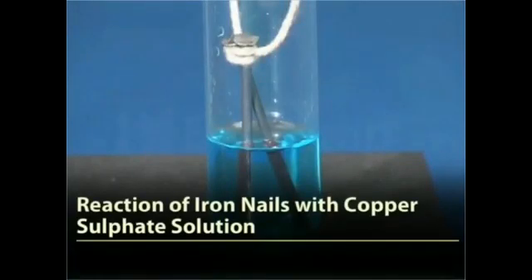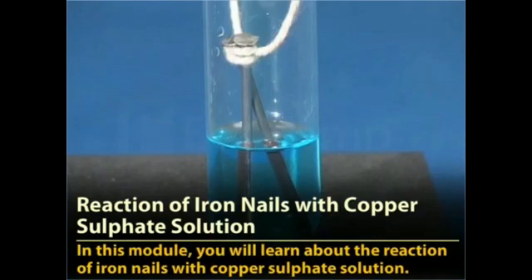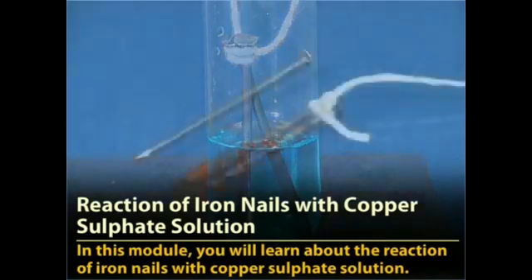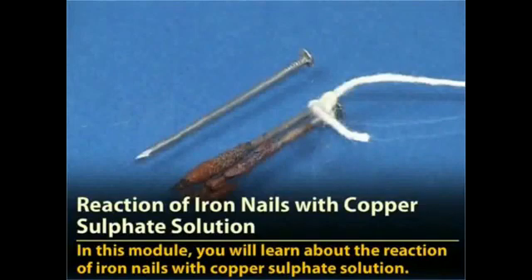Reaction of iron nails with copper sulphate solution. In this module, you will learn about the reaction of iron nails with copper sulphate solution.